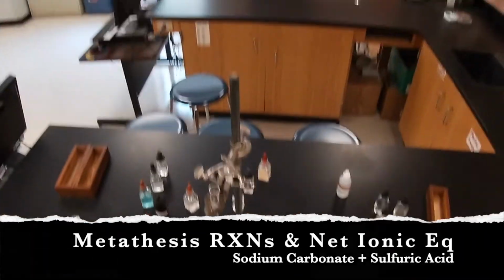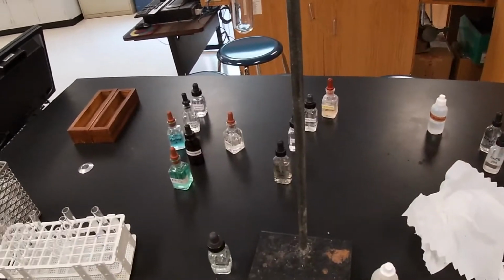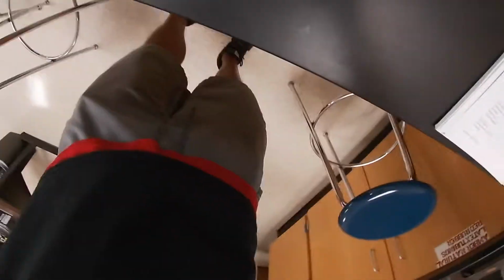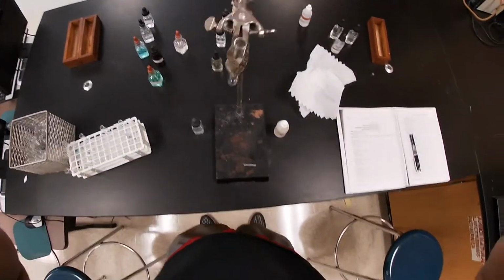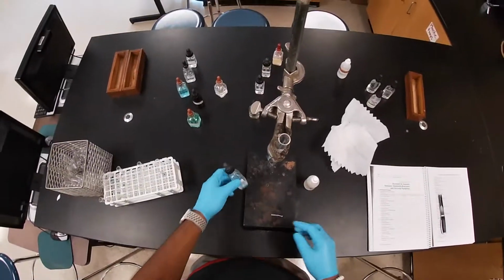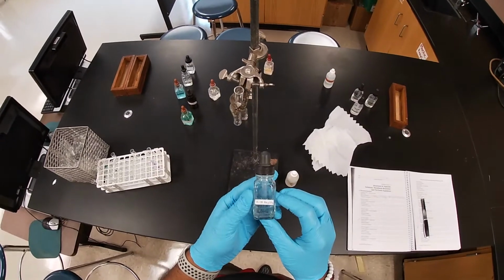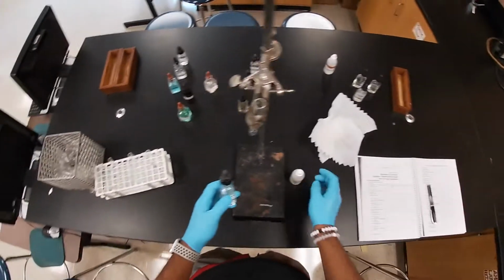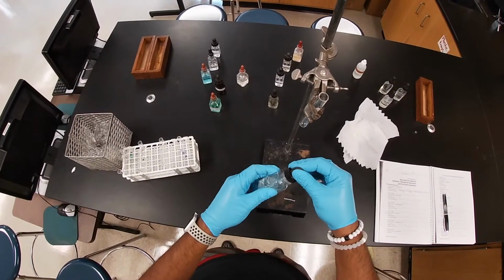The next reaction is going to be between, let me zoom it out, sodium carbonate. As you can see, we got sodium carbonate. We're going to add some sulfuric acid. Just make sure that you get your observations.